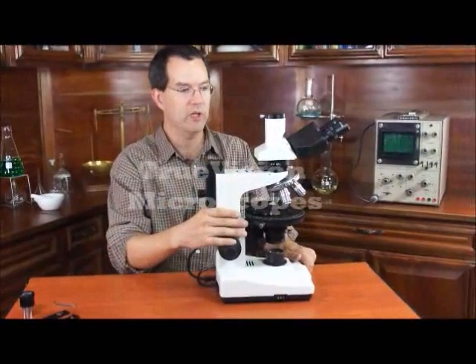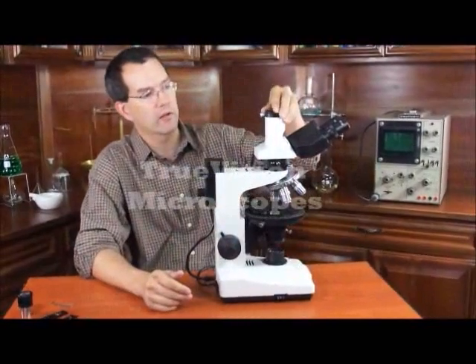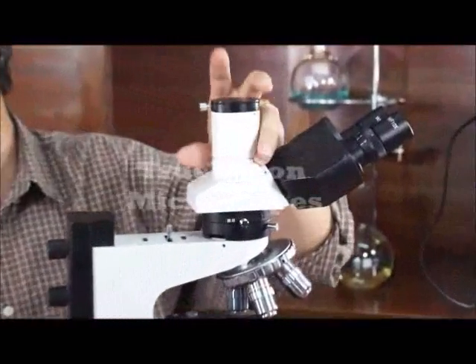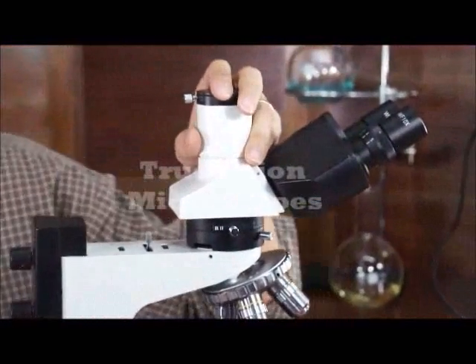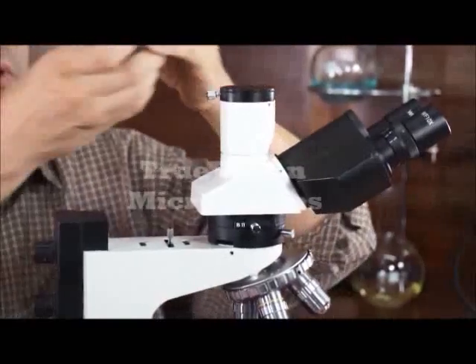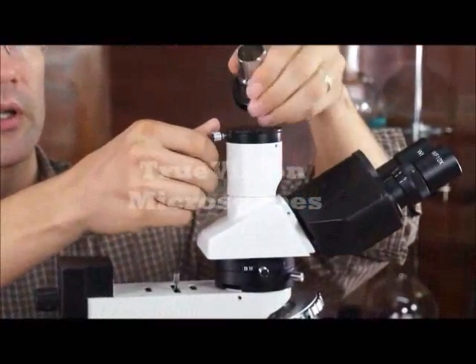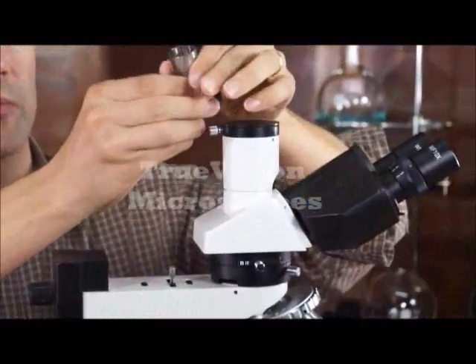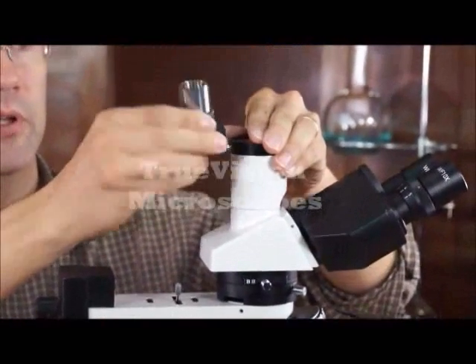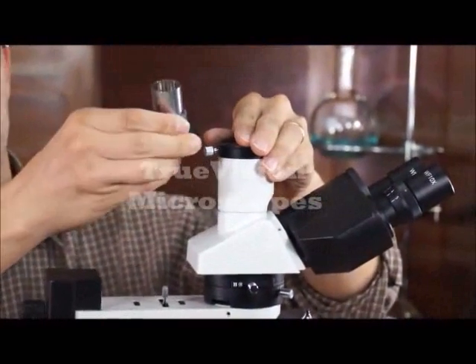This particular microscope is a trinocular, so it has a trinocular video photography port. We can put different attachments on the top — this happens to be a 23mm ID photo tube for connecting camera equipment.